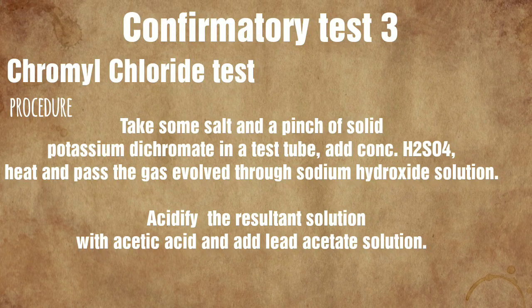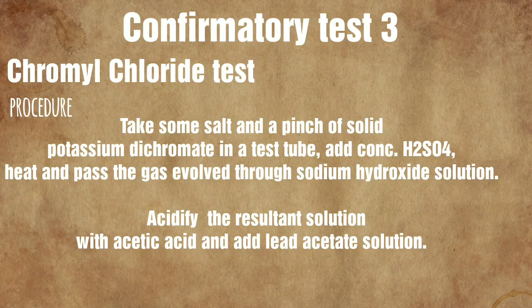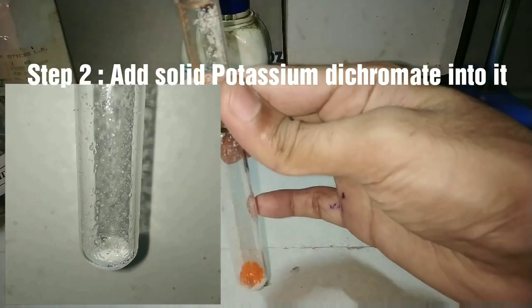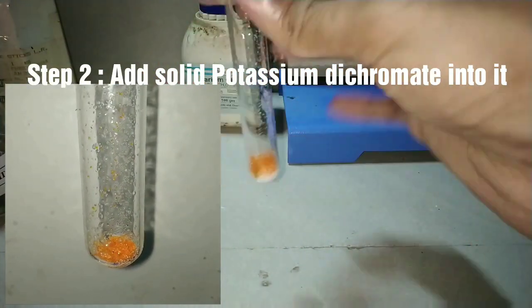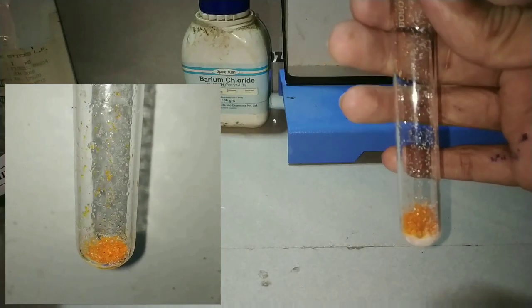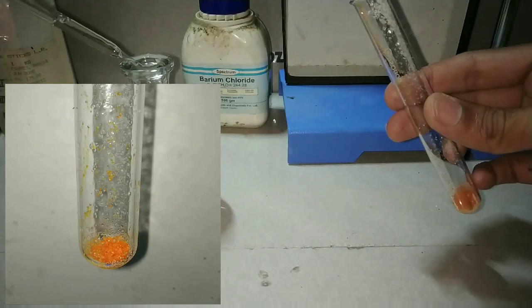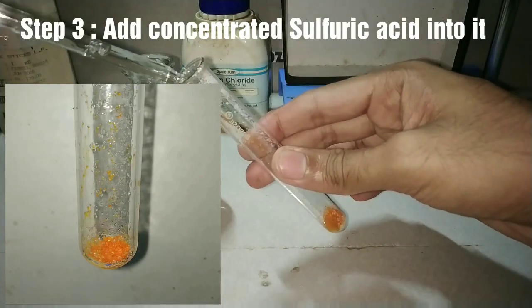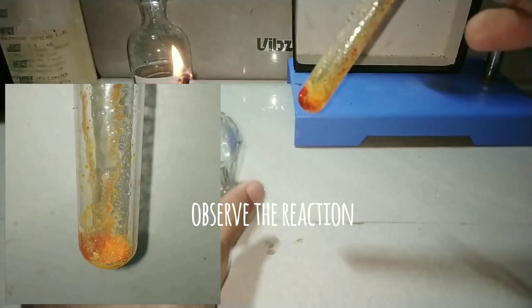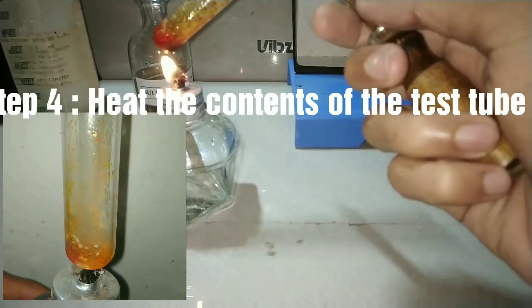The chromyl chloride test involves heating a pinch of solid salt, potassium dichromate, and concentrated sulfuric acid in a test tube, and passing the gas through sodium hydroxide. Step one is to add the solid salt into the test tube — already done. Step two is to add solid potassium dichromate; it has beautiful orange-colored crystals. Step three is to add concentrated sulfuric acid dropwise into the mixture, very slowly, as it is corrosive.